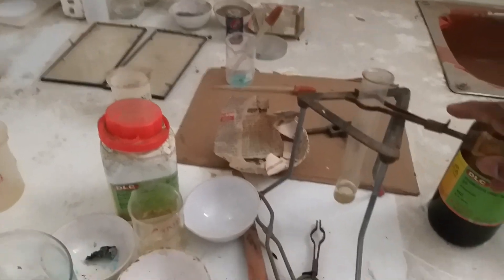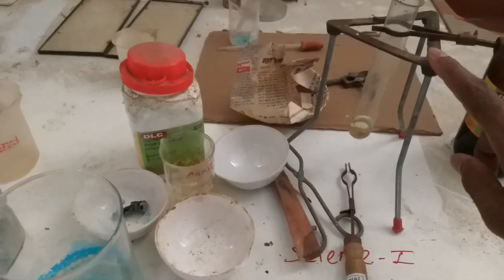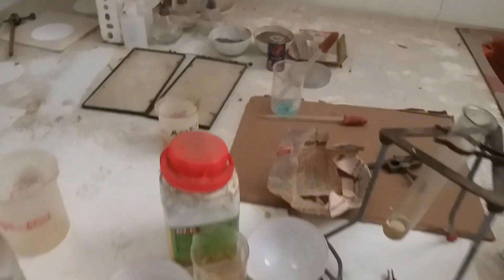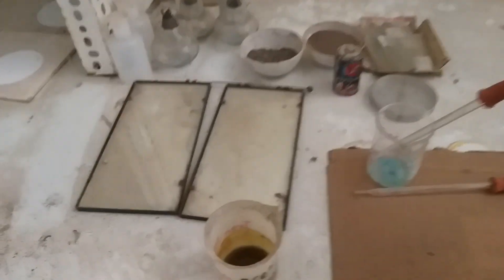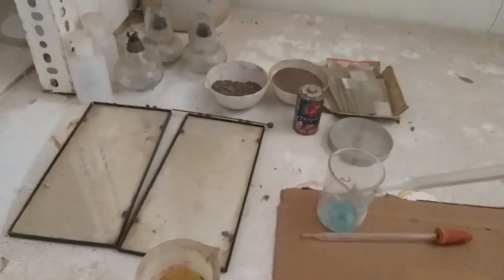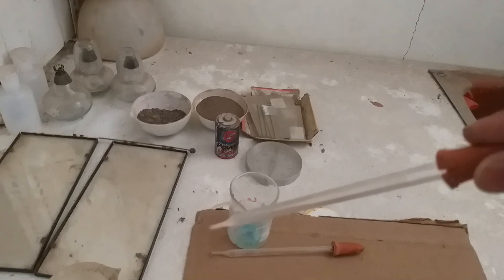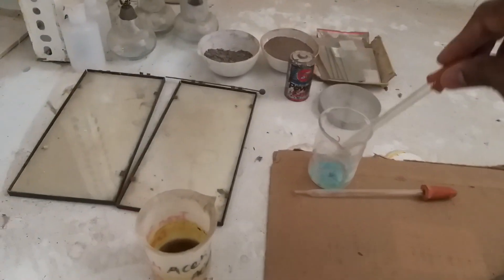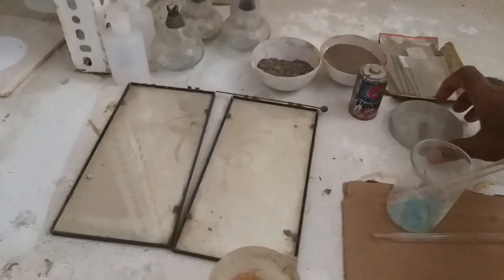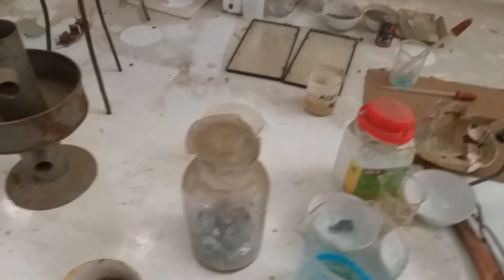Here is a tripod stand. This is a beaker and this is a dropper — with the help of the dropper we can take a solution. This is a magnetic compass, which is a type of magnet.